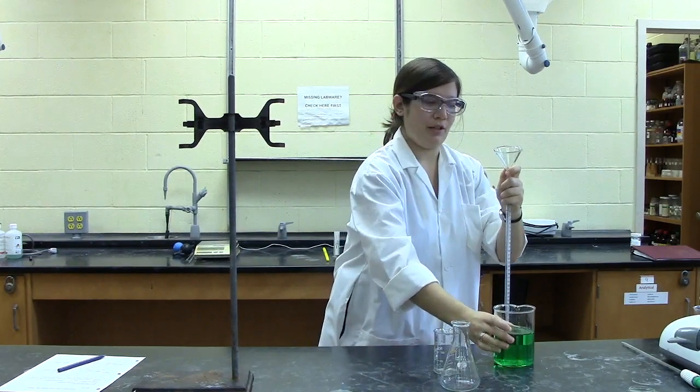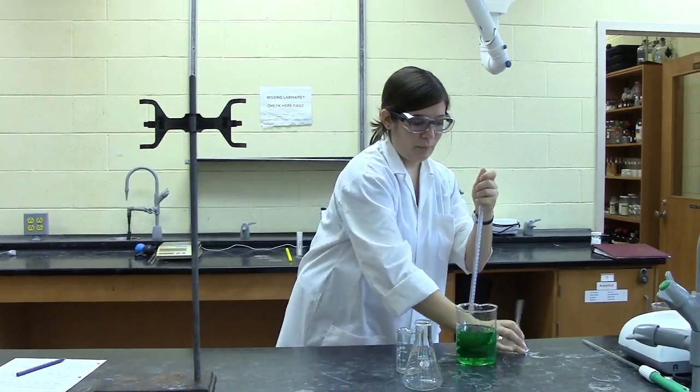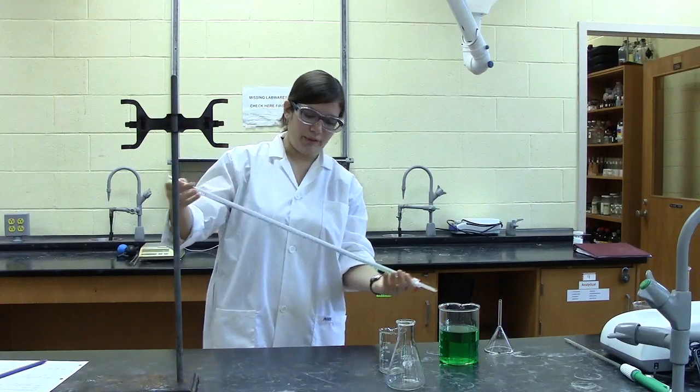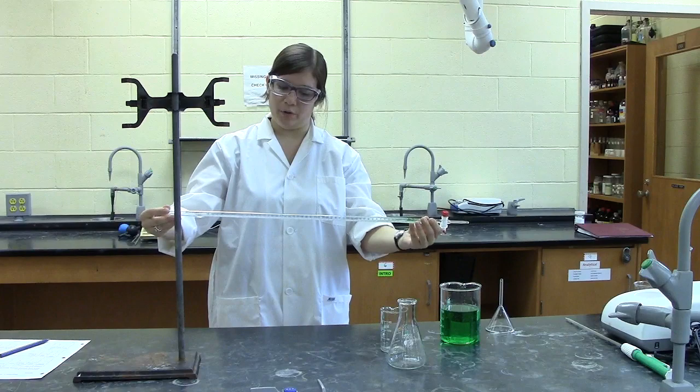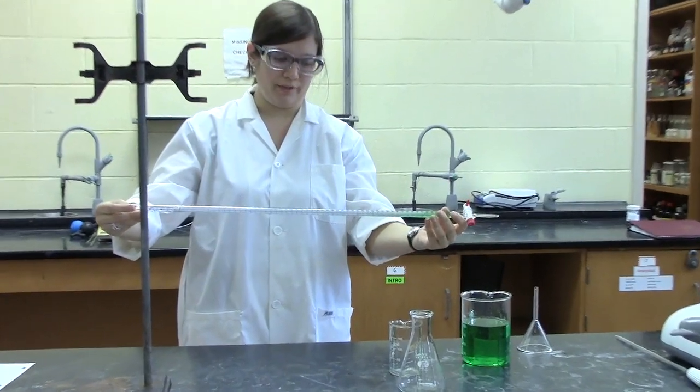Once you have a little of your solution in your burette, you can rinse by holding it a little more parallel so that the solution is covering as much of the side as possible and rotating so that the solution touches all of the sides.